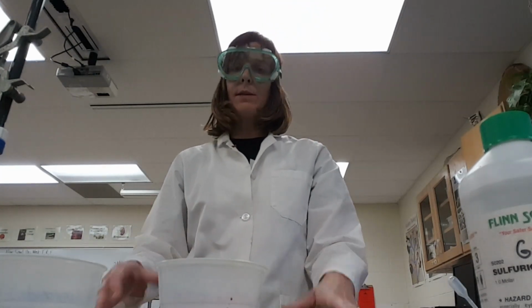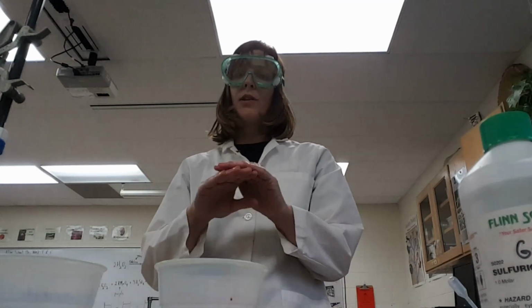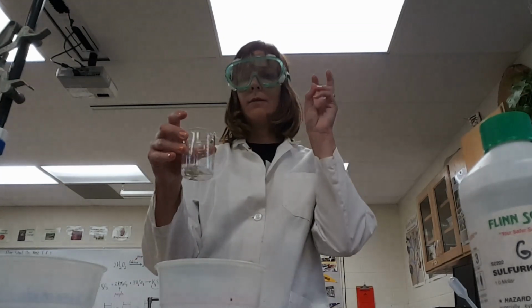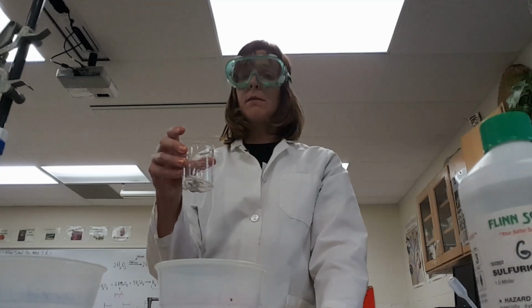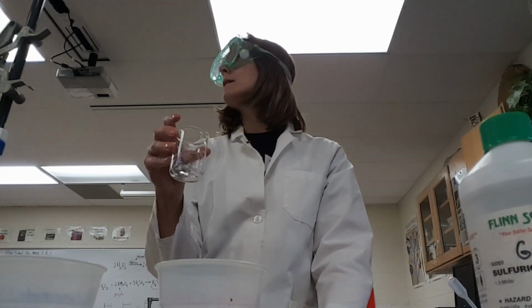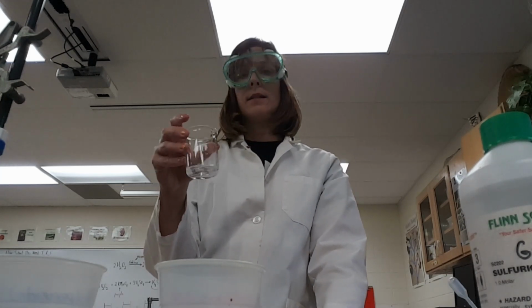All right, now if this was the enzyme-mediated reaction, you would have the stopwatch going because you need to also keep time constant. So I'm going to swirl and I'm going to be timing for, nothing's happening here, but I have to be timing for, let's say 30 seconds. It doesn't matter how much time you use as long as it is consistent. So I'm going to let this go, 30 seconds, tick, tock, tick, tock, tick, tock.